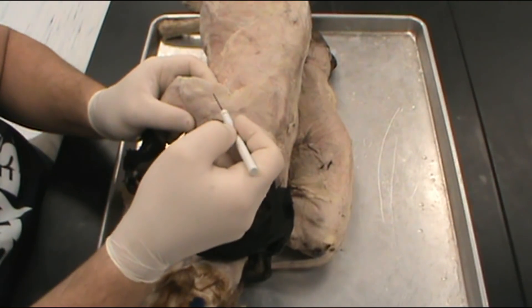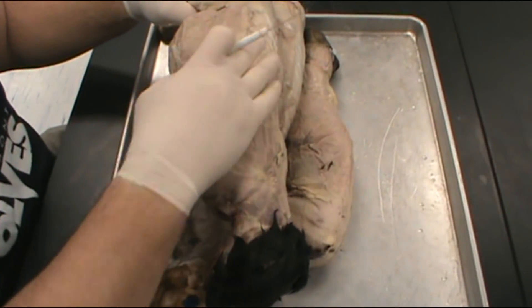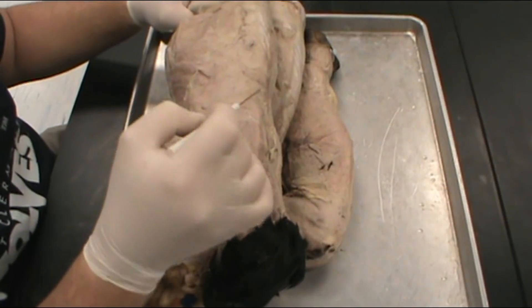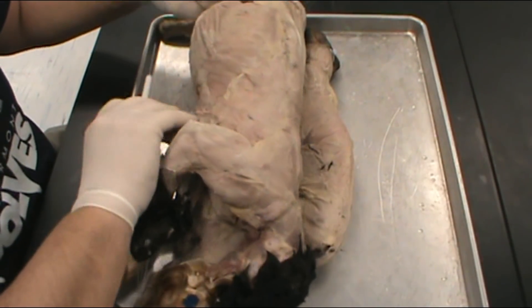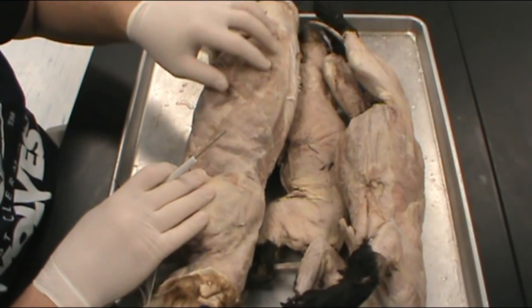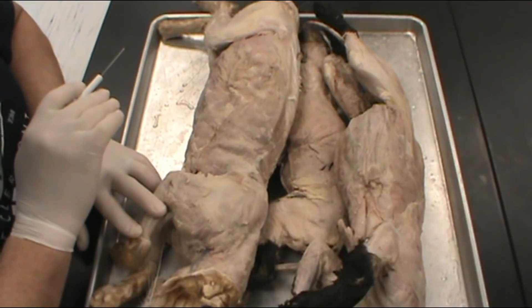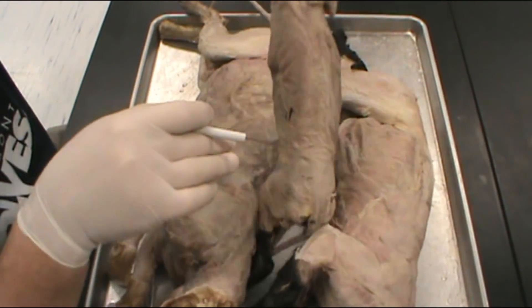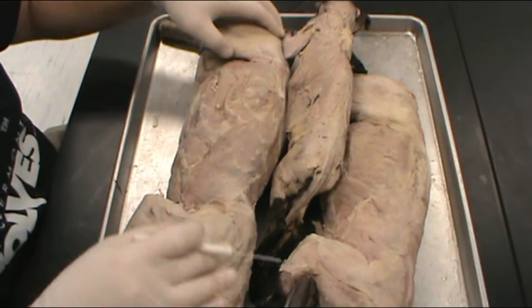Also on the arm, very similar to human musculature, on the back of the forelimb we have the triceps brachii. While we're back here, we'll talk about the large muscle in the back. Someone wasn't very careful in their skinning techniques — there is more than one way to skin a cat, and this way was probably not the best. This large muscle on the back is the latissimus dorsi. Checking the other examples, each cat also has the latissimus dorsi, though some have pieces removed. This large muscle going from the spine all the way up to the armpit is the latissimus dorsi.